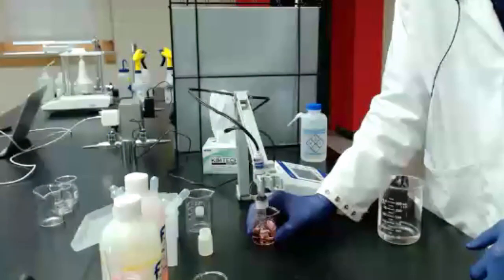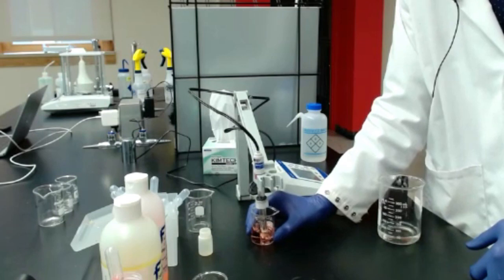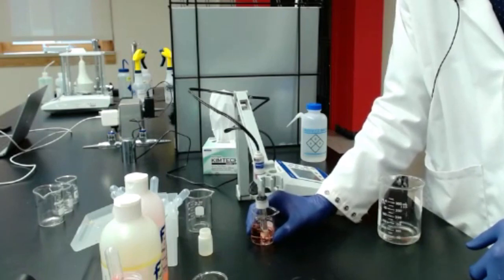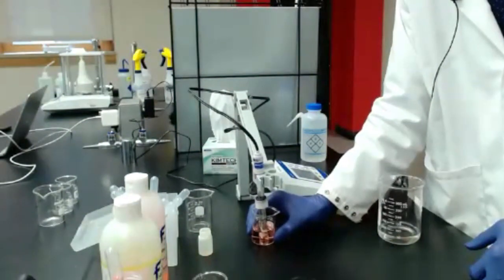You can do it by hand, it's just fine. But if you have a little magnetic stir plate and stir bar, that's really convenient. They'll save your wrists some motion. And when you're doing a whole lot of these, it really makes a difference. We'll see one of those stir plates, if you've never seen one before, in the next workshop in 2 weeks.